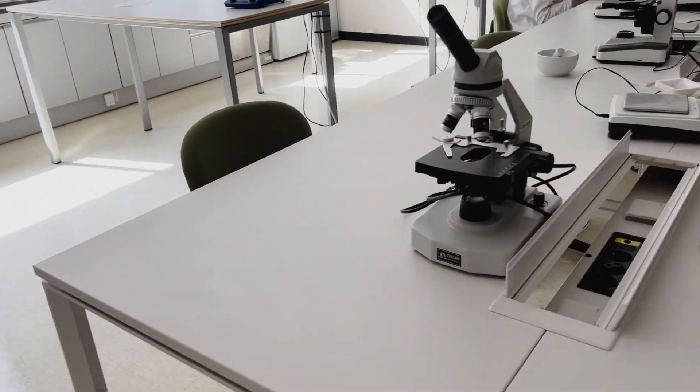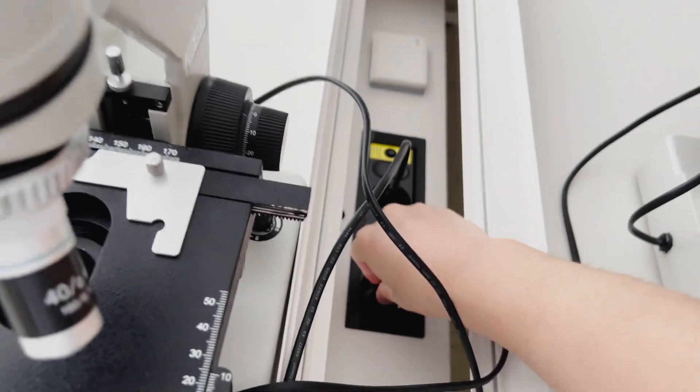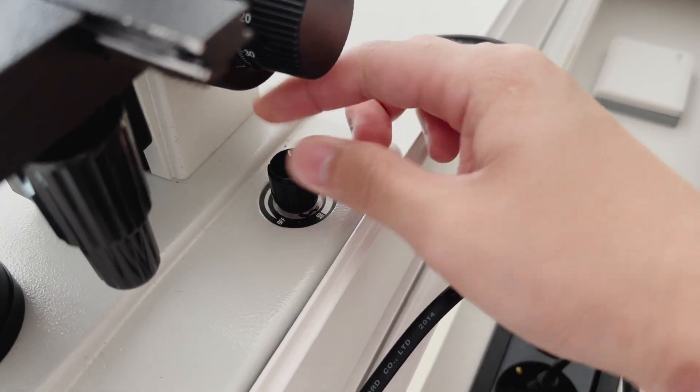Next, get yourself a working microscope. Plug the microscope in and turn on its lights.